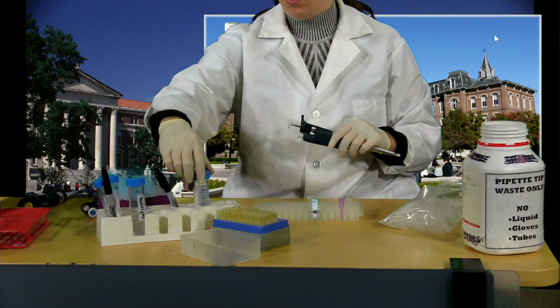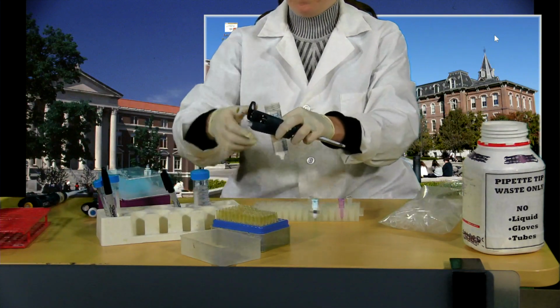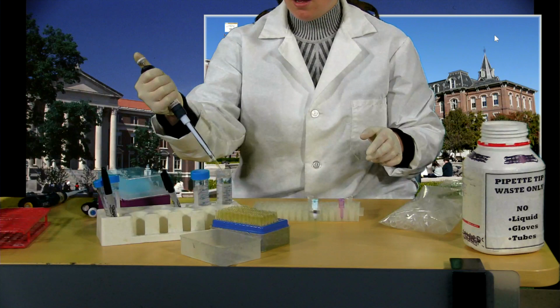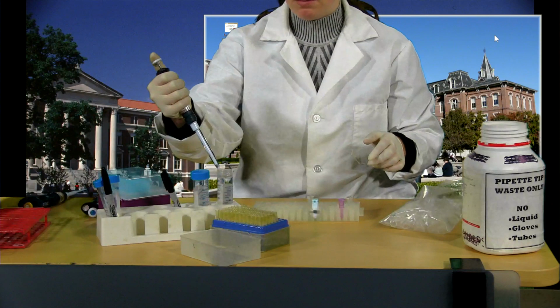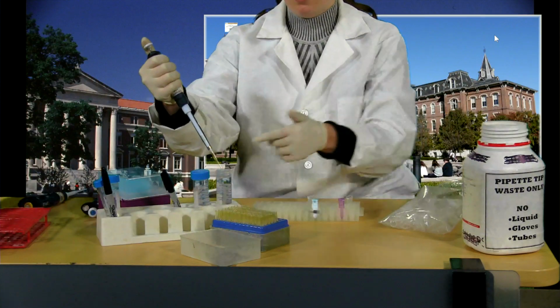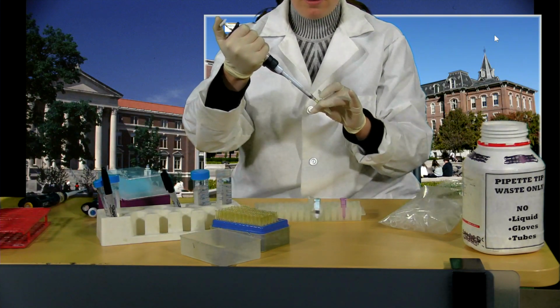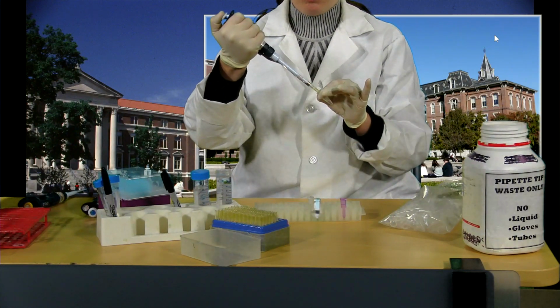And so here is my buffer. Okay, so I've got 180 microliters, and again, I'm being careful here not to totally dunk my pipette tip. Obviously it needs to be below the surface, but try and avoid dipping it too low into the solution, because you'll just get extra drops around the pipette. Okay, I'm going to put 180. And if you like, you can gently pipette this up and down a couple of times. You're pipetting quite a large volume in, so it won't take too much to mix it.